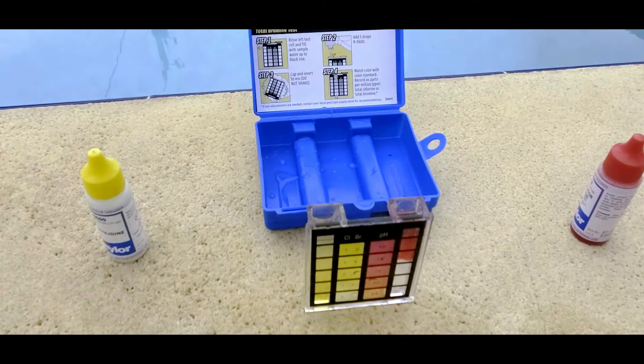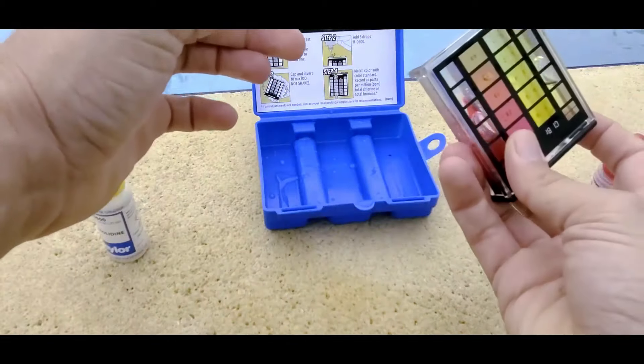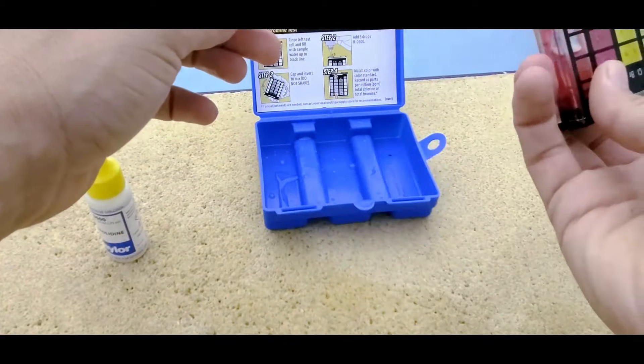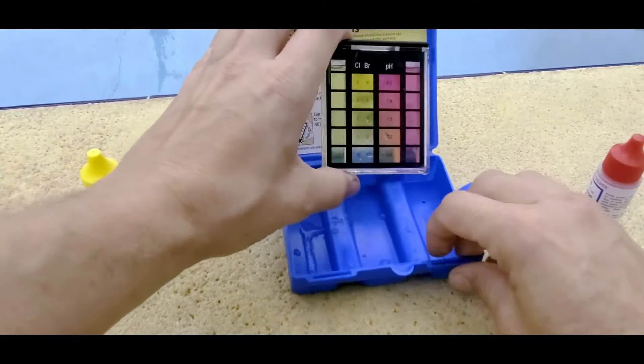And now I'm going to put the cap on. And we just give it a turn or two. Now we can look at it.